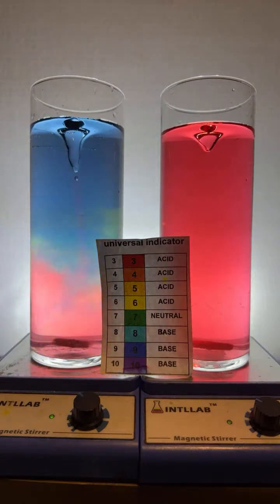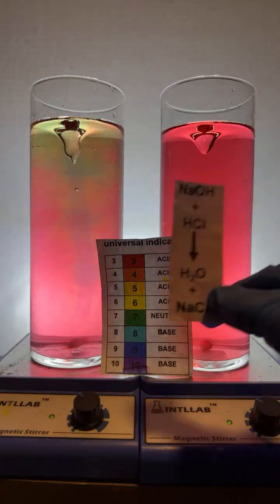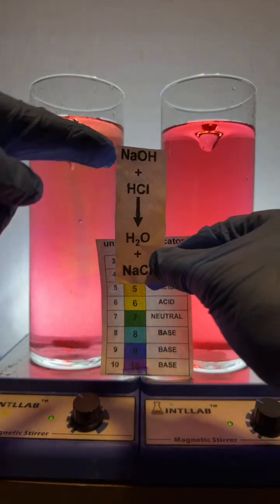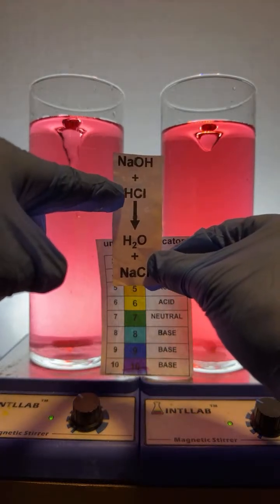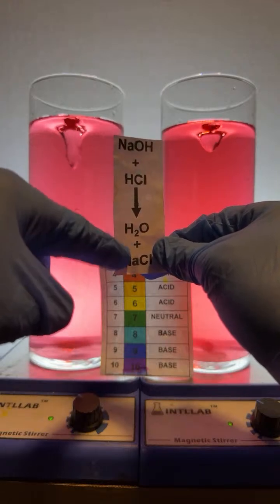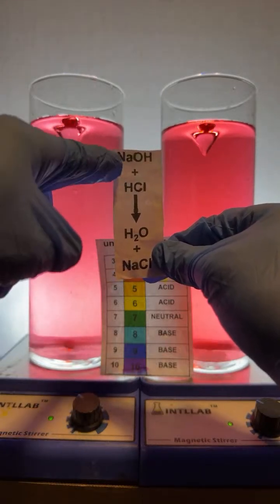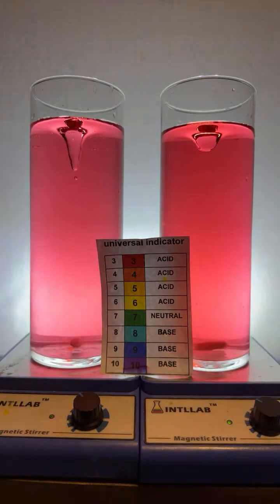So the reaction that's happening is the reaction between sodium hydroxide and hydrochloric acid. The question is, what's causing this to happen? This is the chemical reaction that's happening. The sodium hydroxide, which was making this violet, reacts with hydrochloric acid to form salt and water. These are neutral. That's acidic. This is basic. Now over here, we have an excess of acid, which is why our pH is 3.